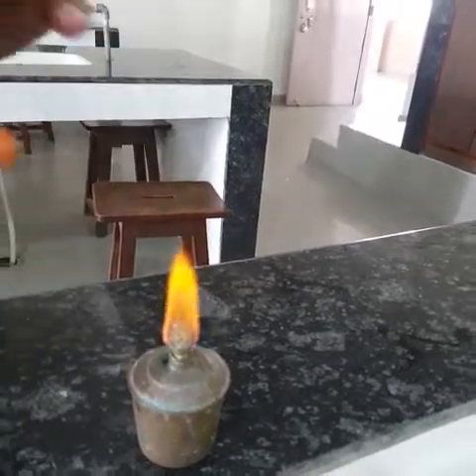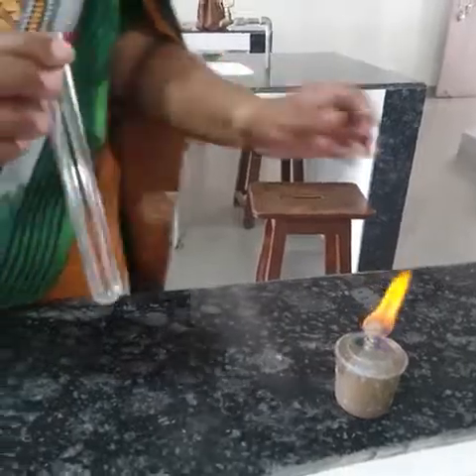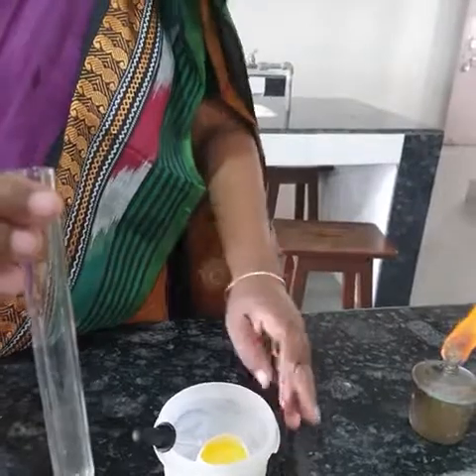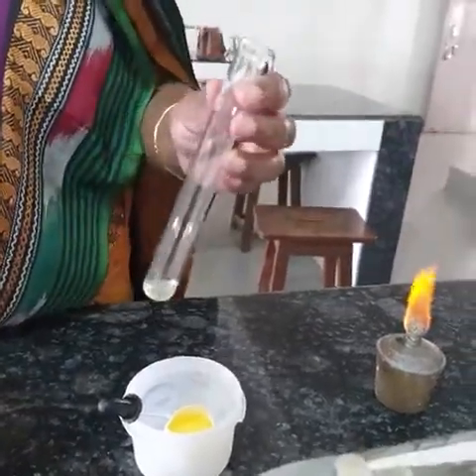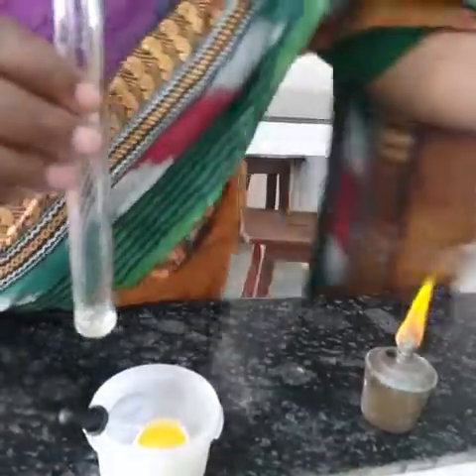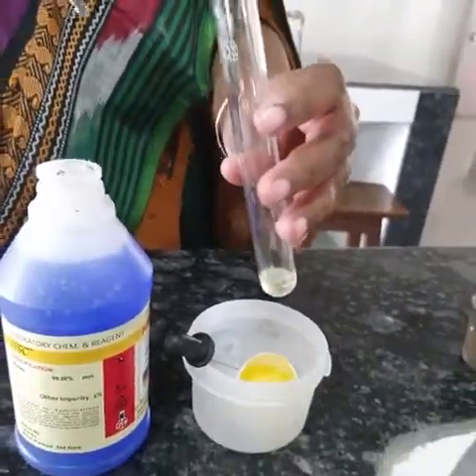Now we will do the protein test. For performing the protein test, we will take a protein sample. We all know egg is rich in protein, so we will take only the egg white — I have removed the yolk. This egg white is taken in a test tube, and to that we are going to add Biuret's reagent. This Biuret's reagent is blue in color.